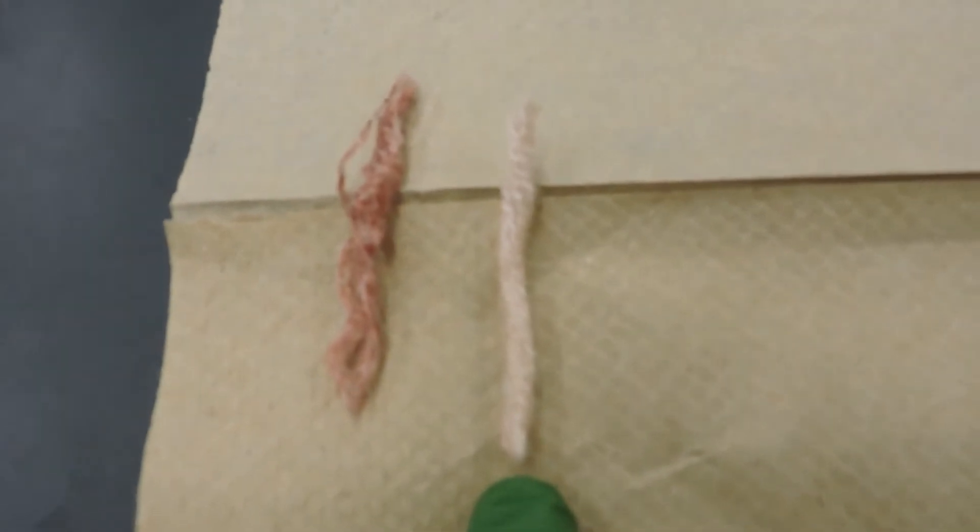Here on the left we have our non-treated piece of wool, and on the right we have our treated piece of wool.